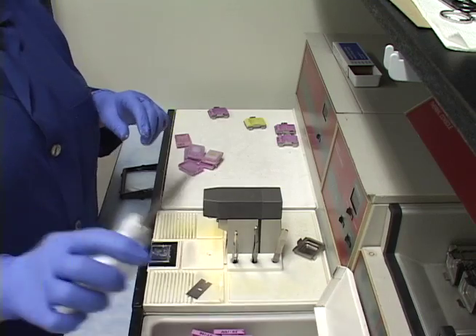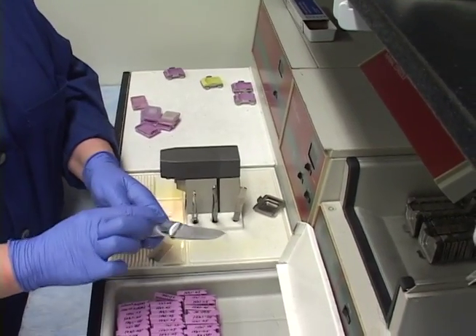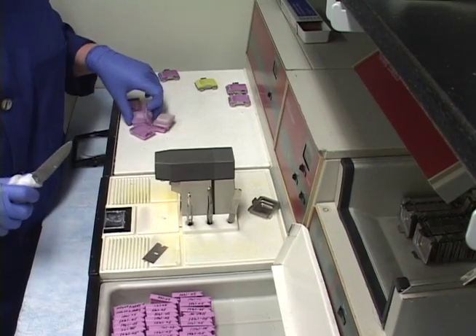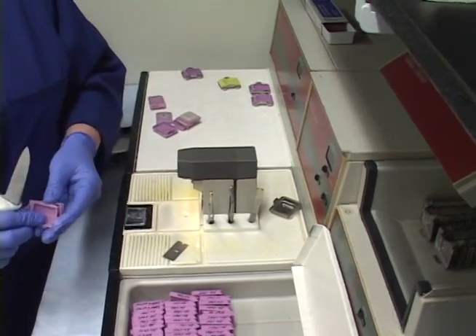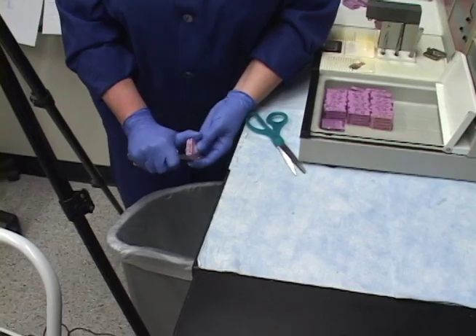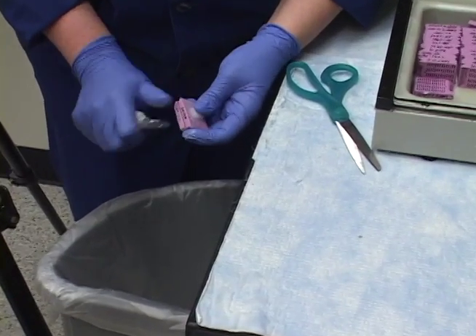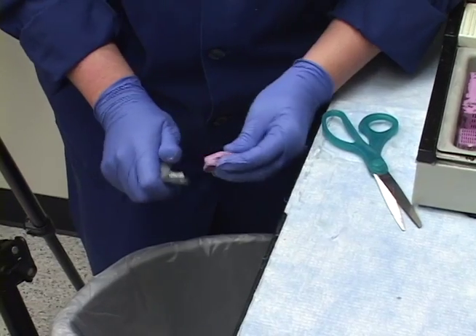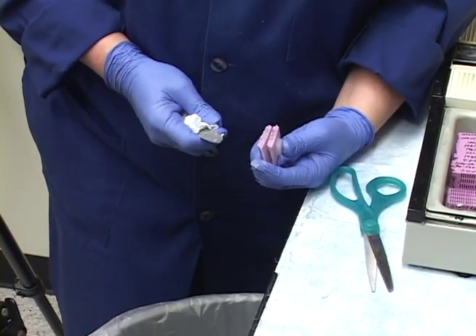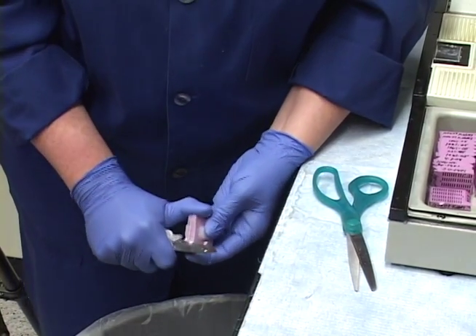This is the knife I use for scraping paraffin — it's actually dull, and I keep gauze around it because the handle gets thick with paraffin. I take two blocks at a time, facing the same way, and scrape them like you're peeling a potato — scrape all the edges. Try not to scrape the numbers off; you're just trying to get the paraffin. This excess paraffin will interfere with microtomy: it'll change your knife angle and the angle of the block.